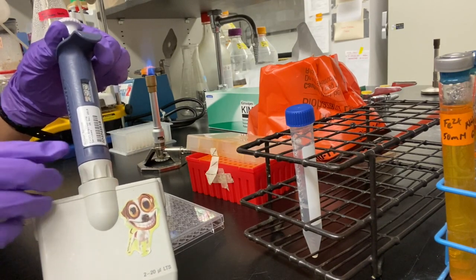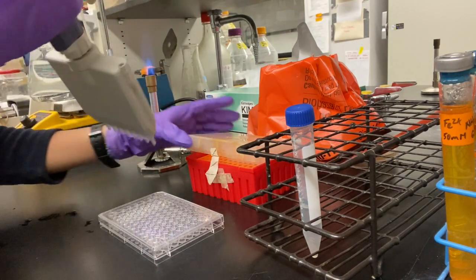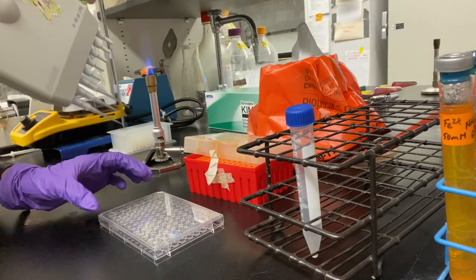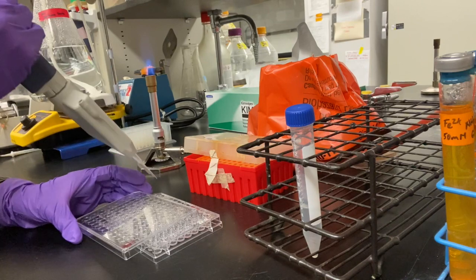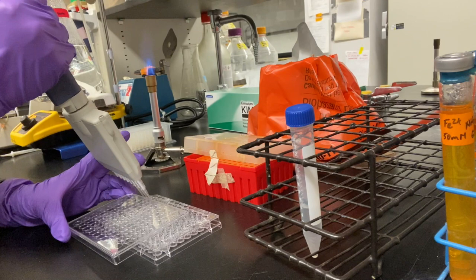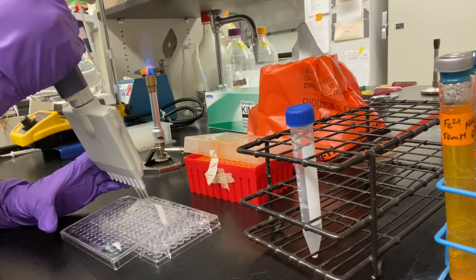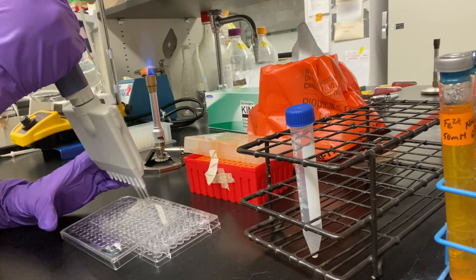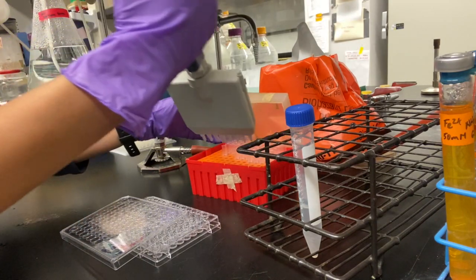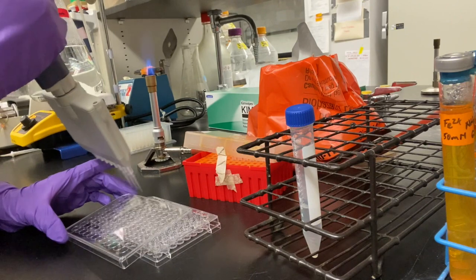Here we will use the 20 microliter multi-channel pipette and corresponding tips. After ensuring that the pipette is set to 20 microliters, grab 3 tips to transfer the triplicates of row A to row B. After dispensing 20 microliters of the stock solution in row A into row B, pipette up and down about 10 to 15 times to ensure that the concentration of row B's triplicates is homogeneous and at a dilution factor of 10 to the minus 1. Then dispose of your tips.